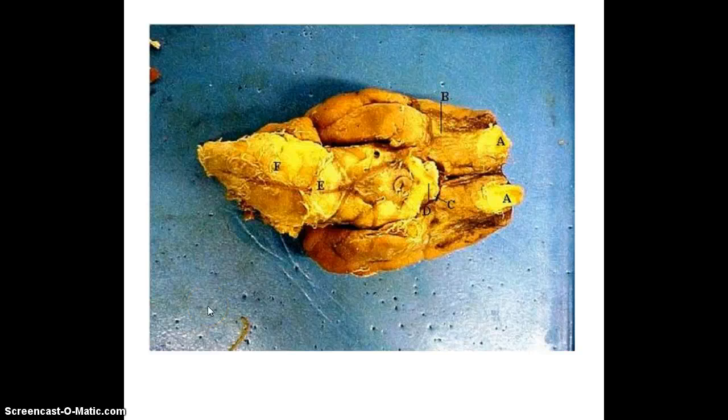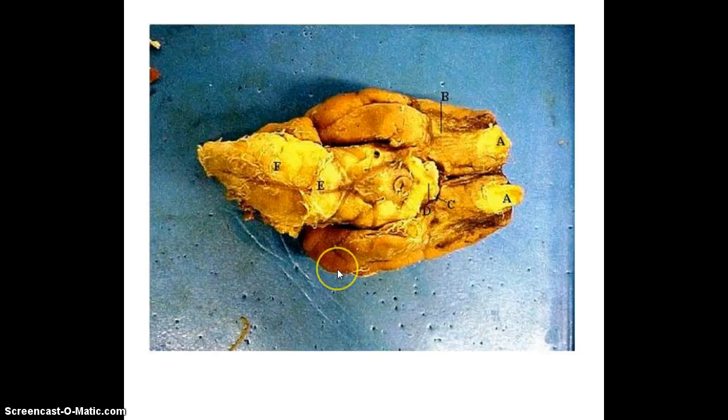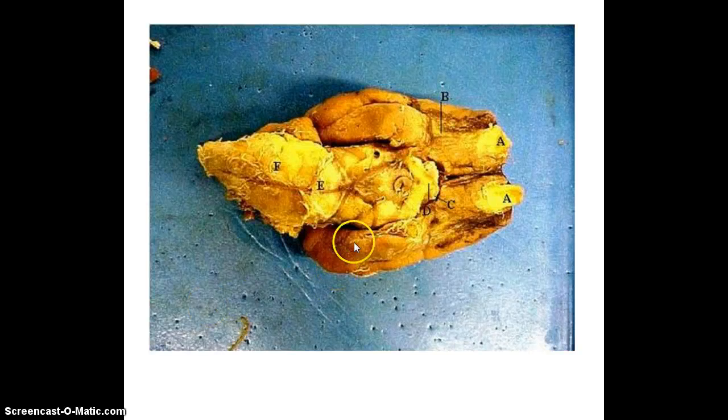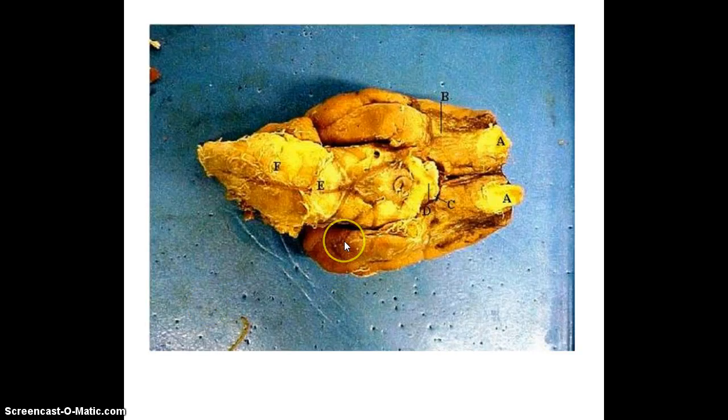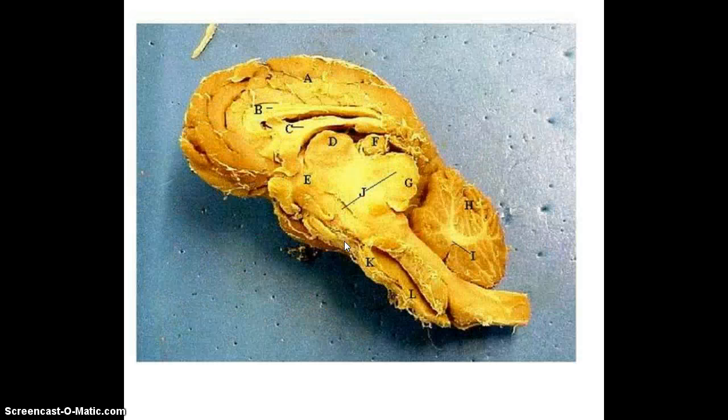In this video, we're going to review the parts of the sheep brain. We're going to look at this view, but first we're going to start here.